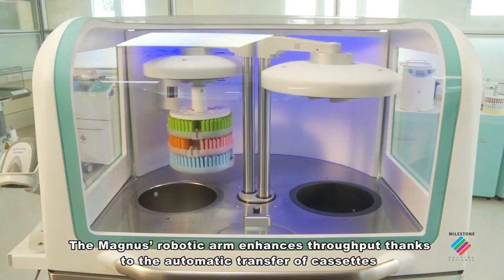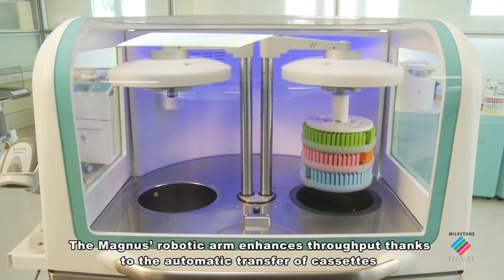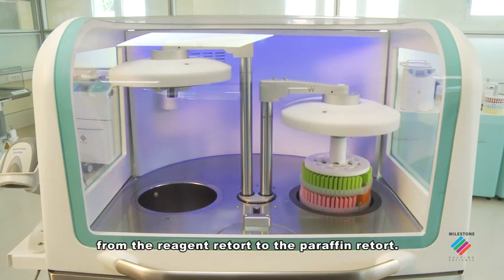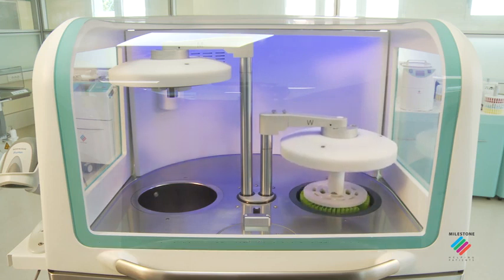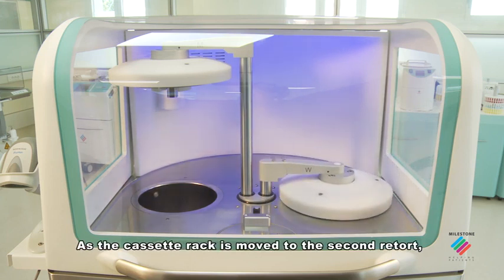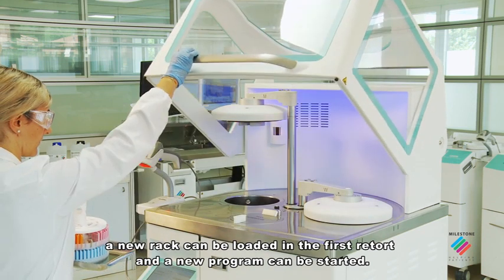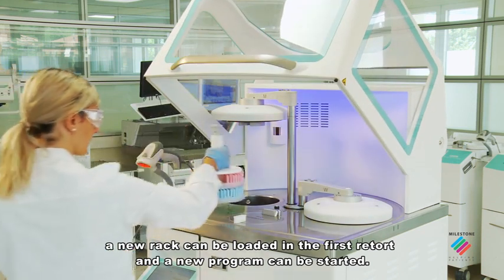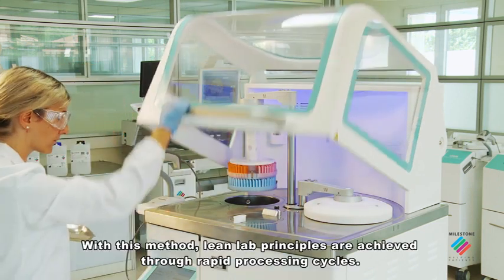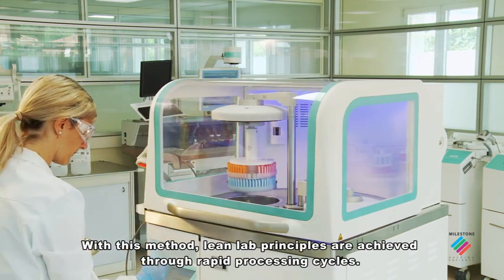The Magnus robotic arm enhances throughput thanks to the automatic transfer of cassettes from the reagent retort to the paraffin retort. As the cassette rack is moved to the second retort, a new rack can be loaded in the first retort and a new program can be started. With this method, lean lab principles are achieved through rapid processing cycles.